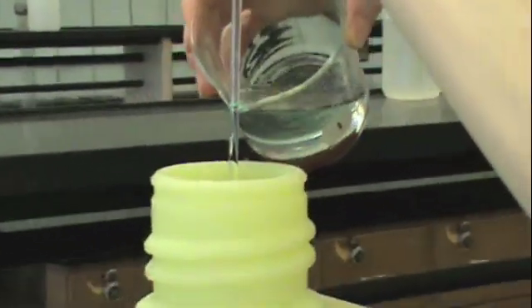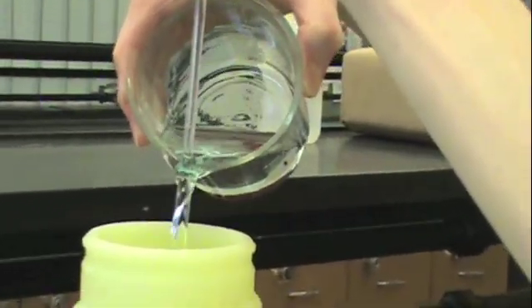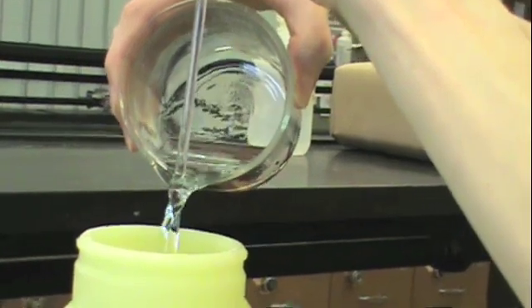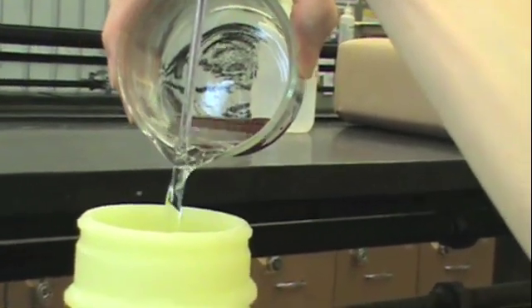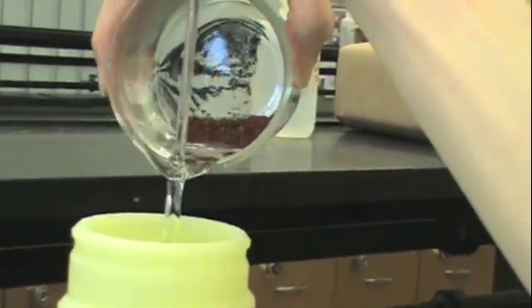We will then decant the almost colorless solution into this specially designated waste container. Be careful not to get any copper into this container. Just the filtrate should go in here.